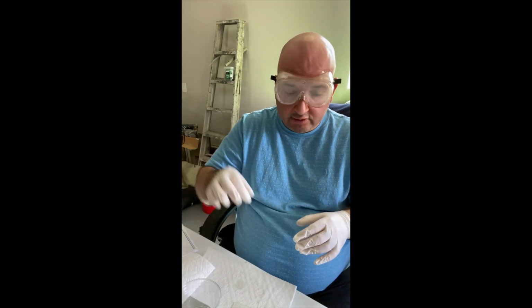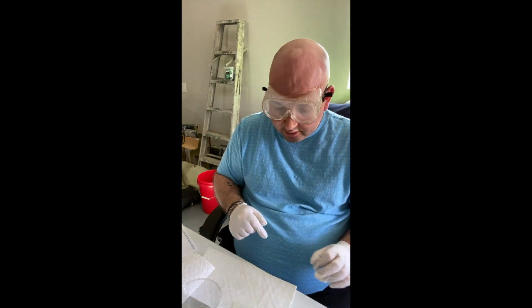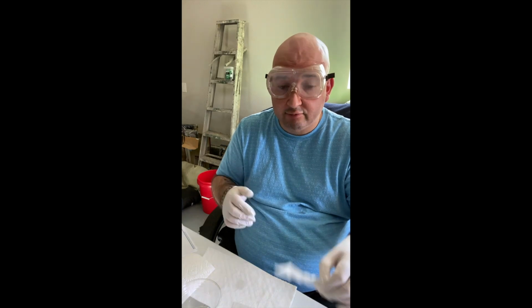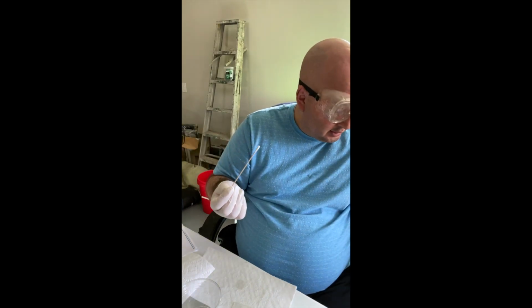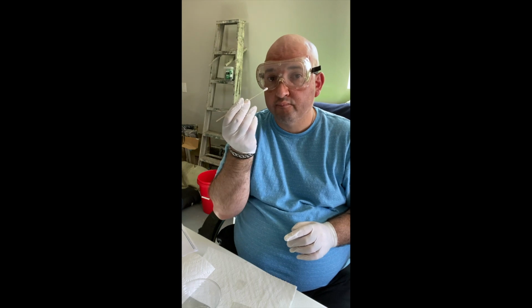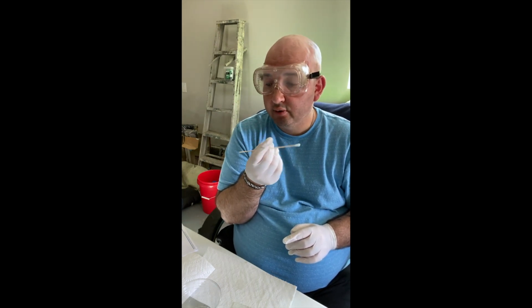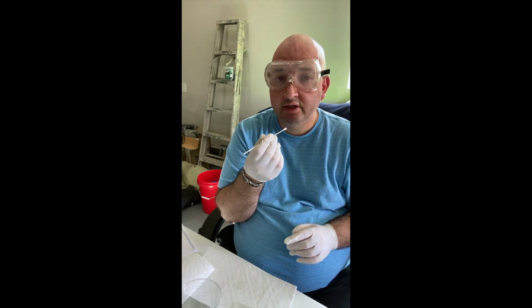I'm just going to put them to the side here so I don't mix them with the next specimen that I'm going to collect, which is going to be my plaque cells from my teeth. So my last swab, this is going to go in the trash, and this time I'm going to place the Q-tip or the swab against my teeth near the gum line to get a sample.